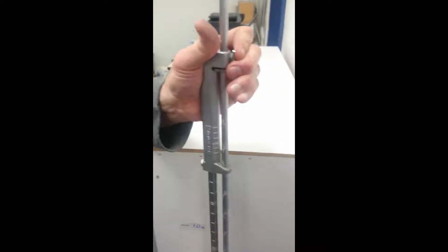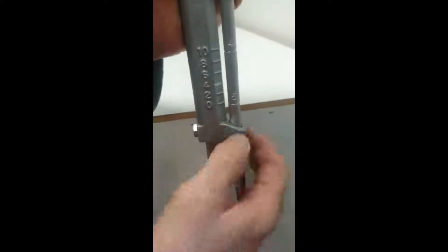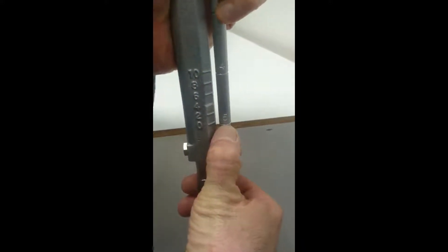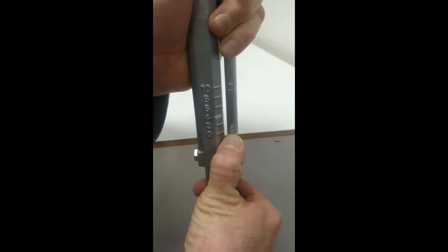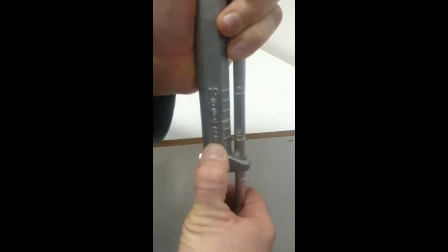So now we're going to squeeze this button here - it's kind of new so you've got to squeeze quite hard. And what we're going to do is we're going to take that 50 centimeters and we're going to relay it from the small pole back onto this. This represents the tens position of your number, and this is the fine scale, this represents the ones position.